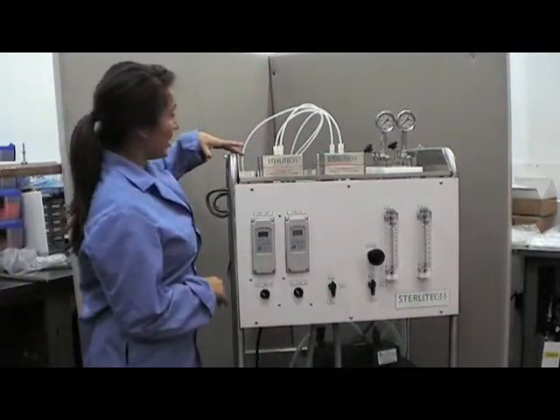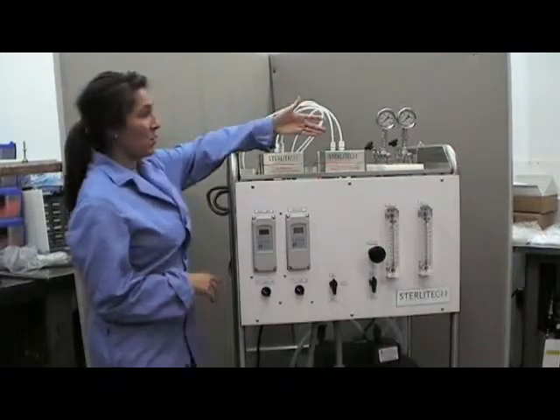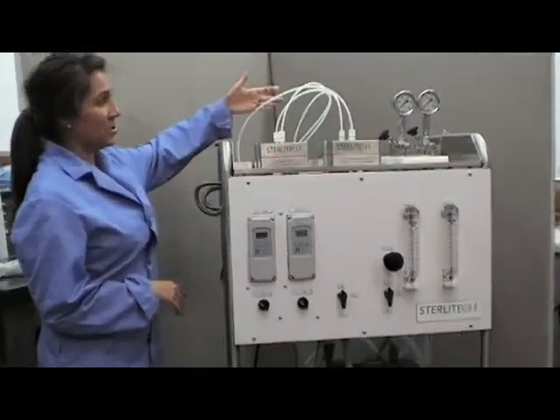Up here you'll see that the two lines are clearly marked. The front is line one. The back is line two.